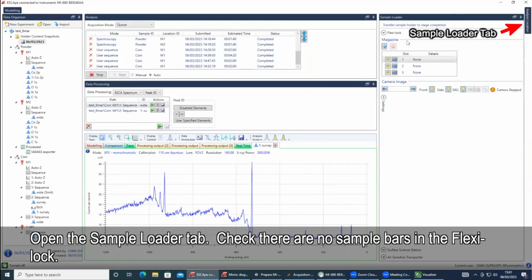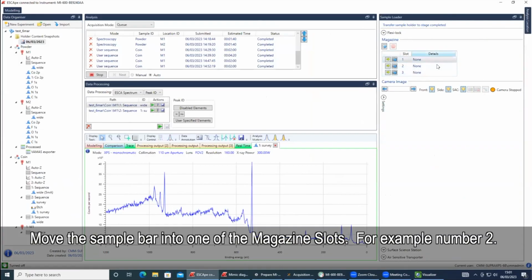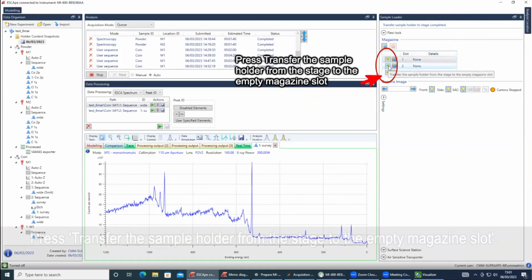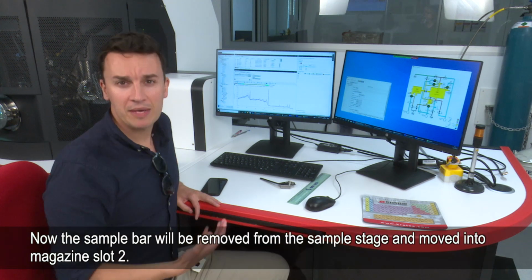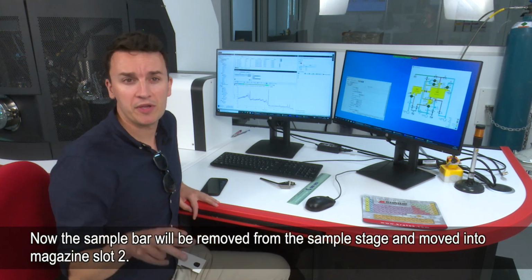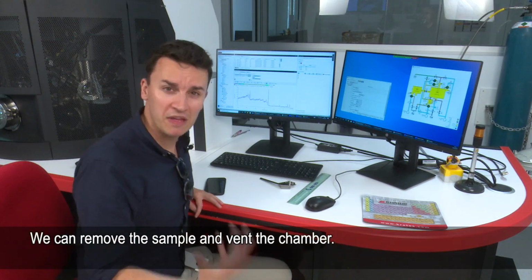I'm just going to go to the sample loader tab, and you see now there are no sample bars in the FlexiLock. So I'm just going to move the sample bar into one of these. So we'll pick number 2, and I'll press transfer the sample holder from the stage to the empty magazine slot. So now the sample bar will be removed from the sample stage, go into the magazine slot, and then we can remove the sample, we can vent the chamber.